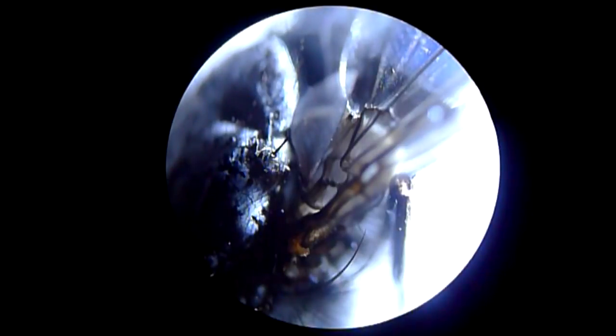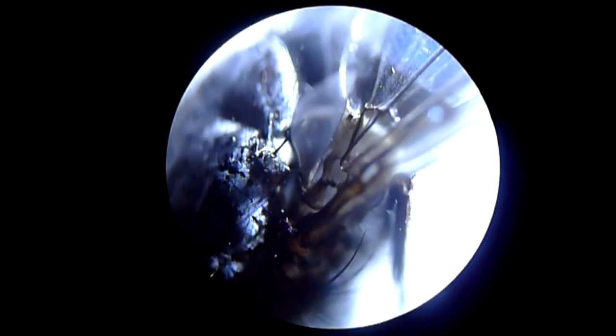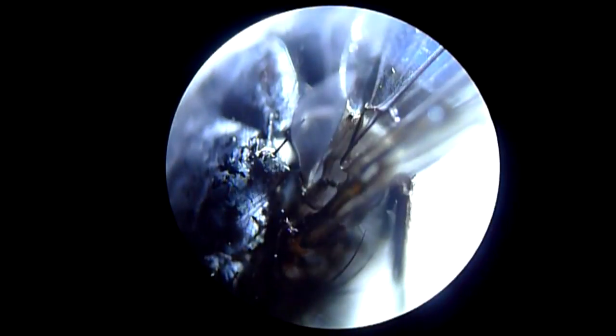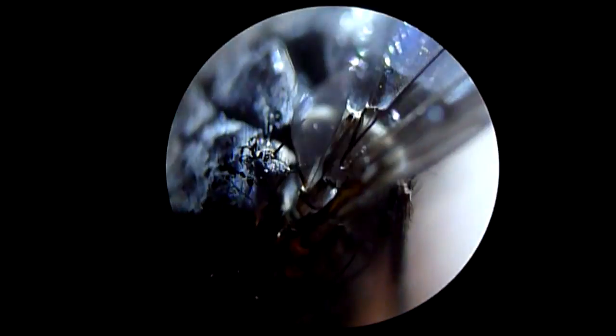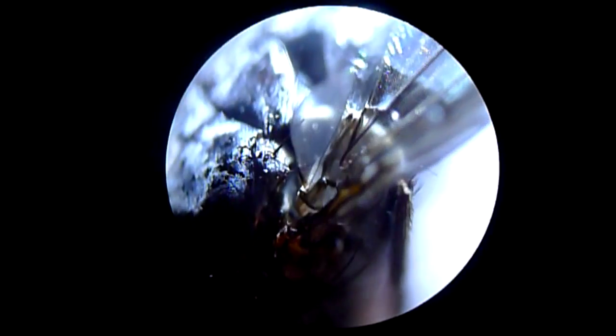These LED lights are pretty good. I'm using it by hand. If I was to take a photograph or even remotely attempt the amazing photos of Charles Krebs, I'd be obviously holding it still and using a proper trinocular for the camera. But still, I find it pretty amazing what you can see. I'll just rest this on the tripod. I'll have to get a right band for it, I think. You can see all the different details on the wings. This is the base of the hinge of the wing.